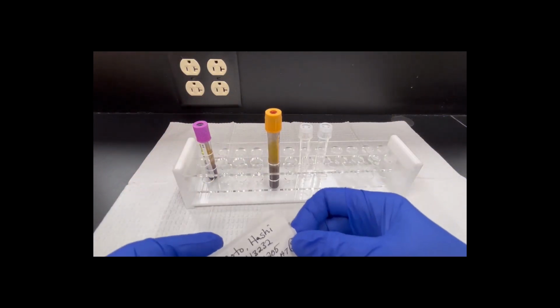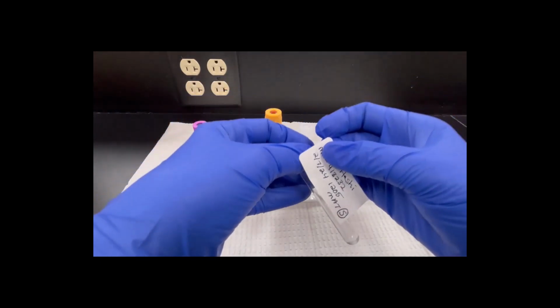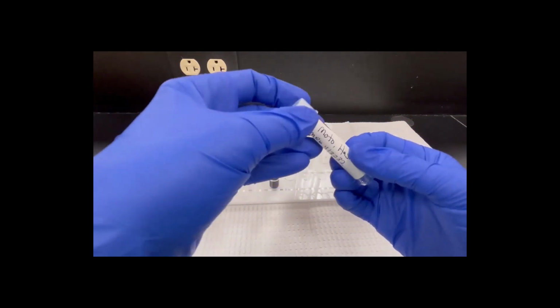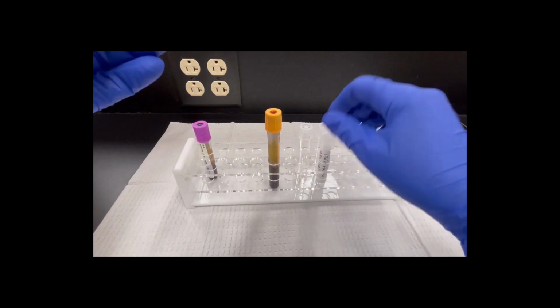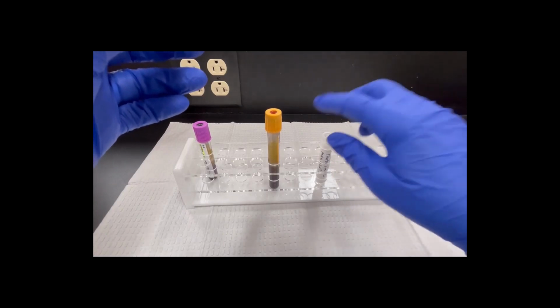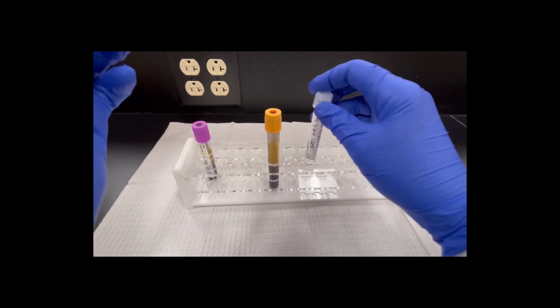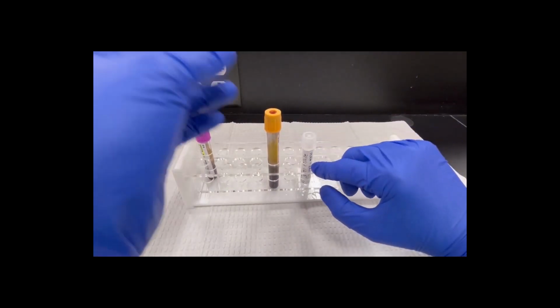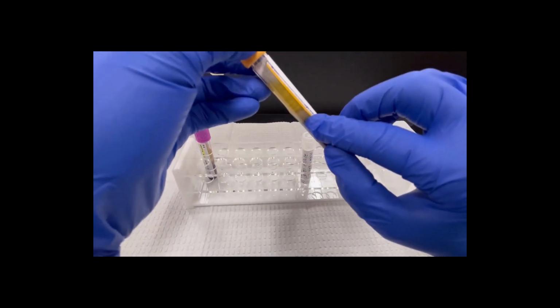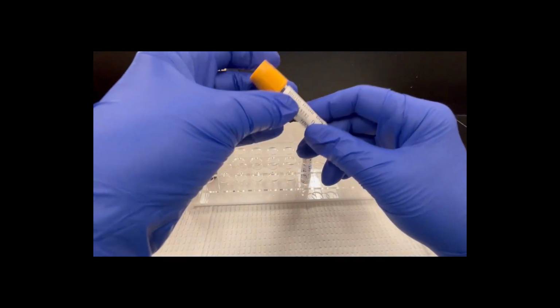So I'm going to take this label, and I'm going to put it on my aliquot tube. We always put the label's last name on the top of the tube. The reason we do this is when we have racks and racks full of tubes, I can pull those out, set those aside, and see who that is. If I had this tube upside down, I'd only be able to see that much and I wouldn't be able to tell. So when I have racks and racks of tubes, we always want the last name up on top. So you can see when we label this, I have the label here, the yellow showing on the tube, and the last name is up on the top by the lid.